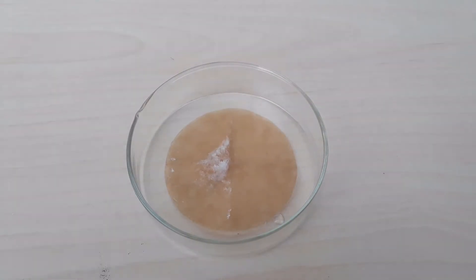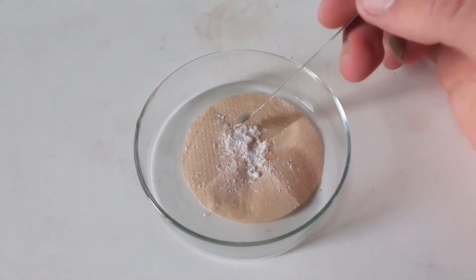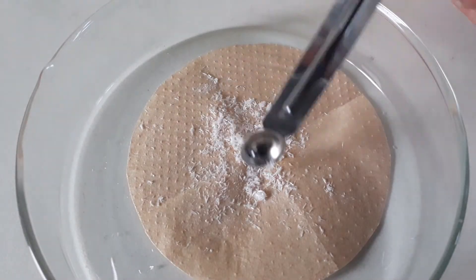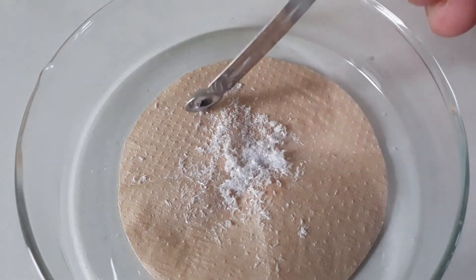These are the crystals right after filtration, and this is the dried product on a filter paper. It is actually too small of an amount for my scales to measure, so I'd guess it is around 80 mg, which would be a 40% yield.